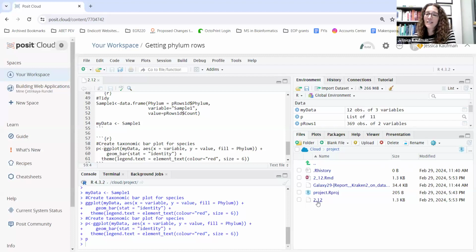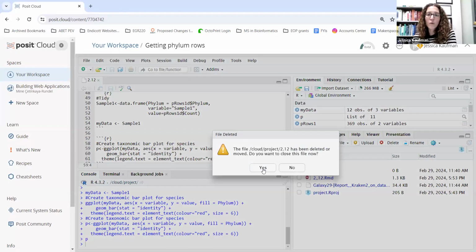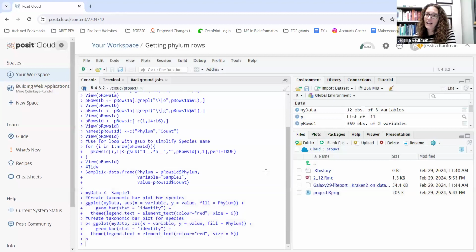I could save it by clicking rename, but I have the renamed one here, so I don't have to. But if you're running into that problem, definitely just avoid the dots, and I think you will be fine with any other file names as long as it doesn't have a period in the middle of what you think of as the file name.